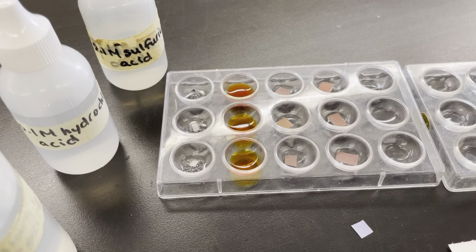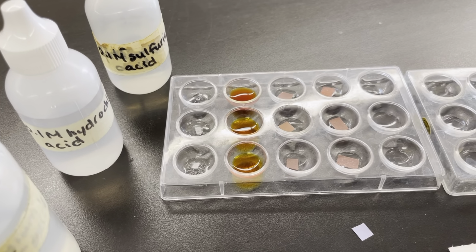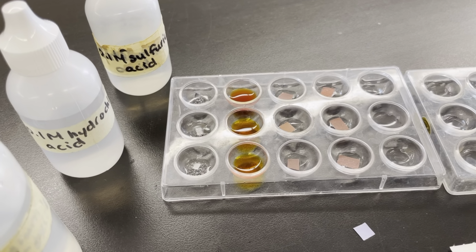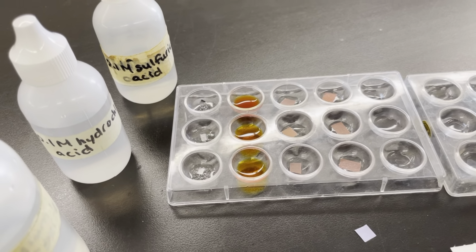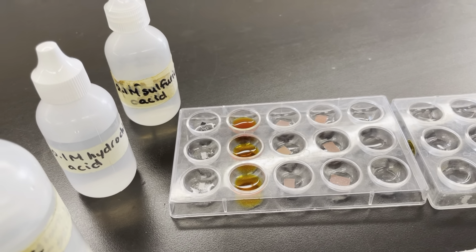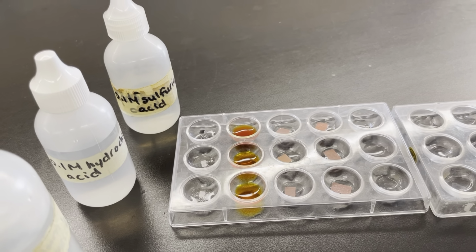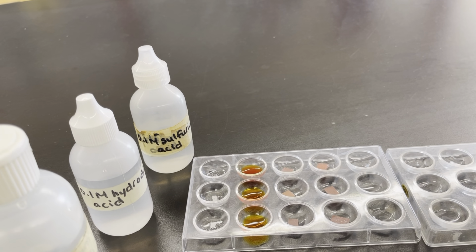That does not look the same. Whenever we use litmus paper, we either describe it as red or blue. If it looks pink, it means it's red. Even if the blue has a bit of a purple tint to it, it's still blue. Either red or blue, those are our two colors that we use for our observations.